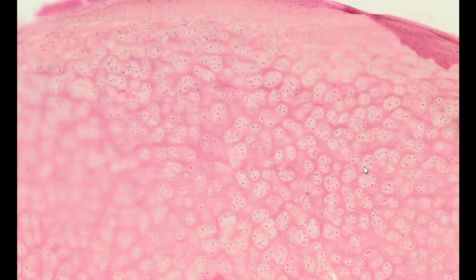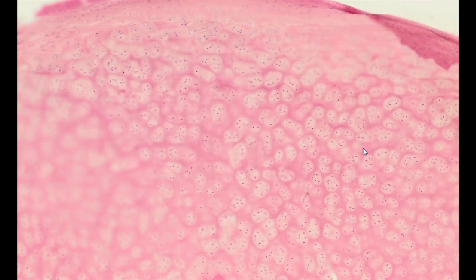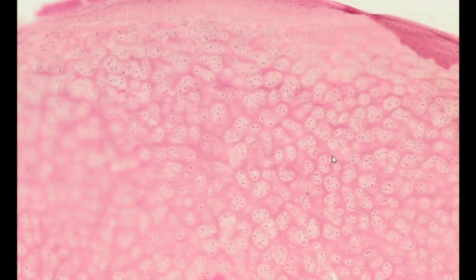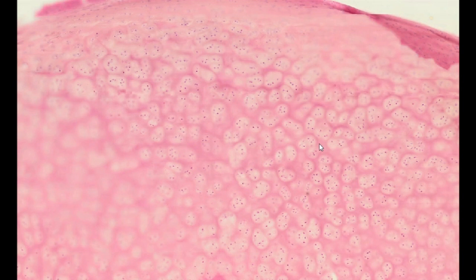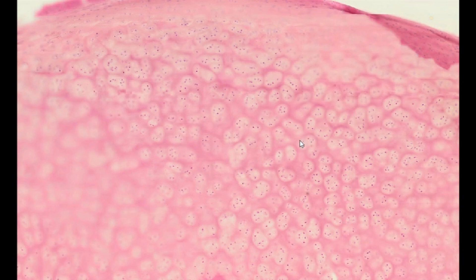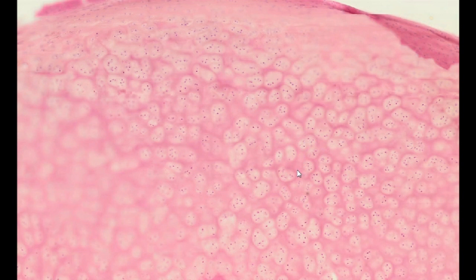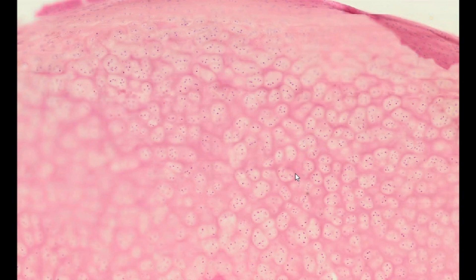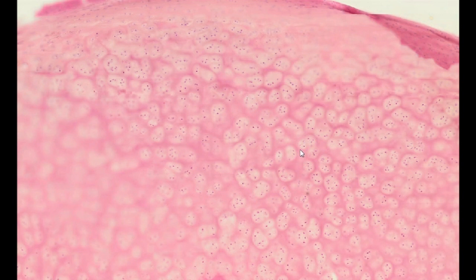Like any connective tissue, it consists of cells and extracellular substance. Mature hyaline cartilage is characterized by the presence of small clusters of chondrocytes embedded in the ground substance or the matrix.